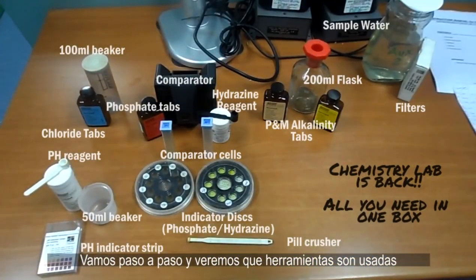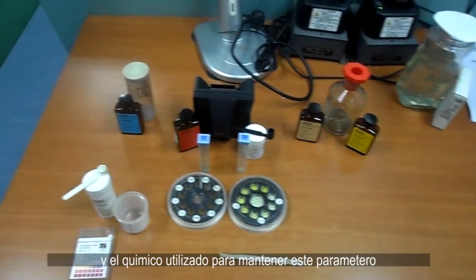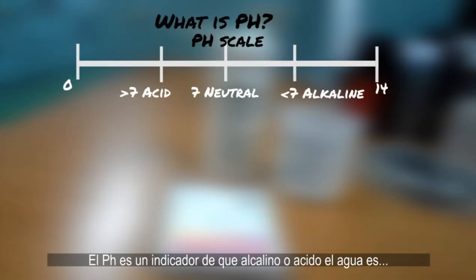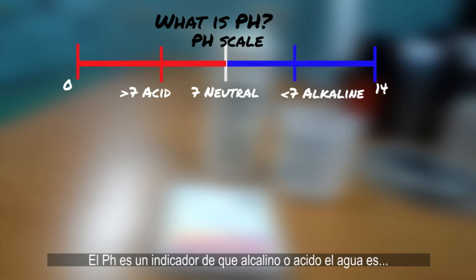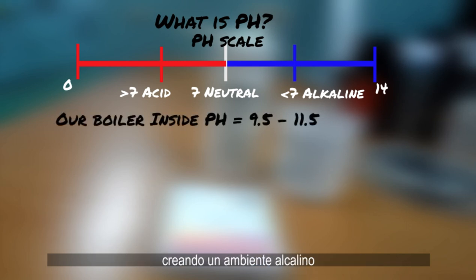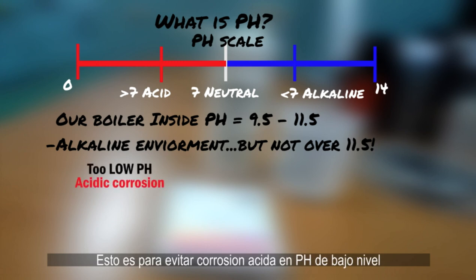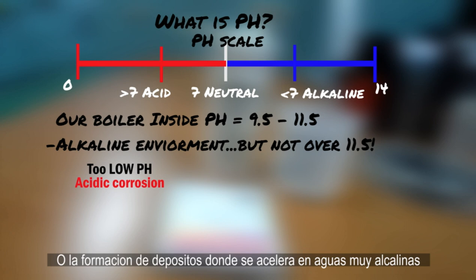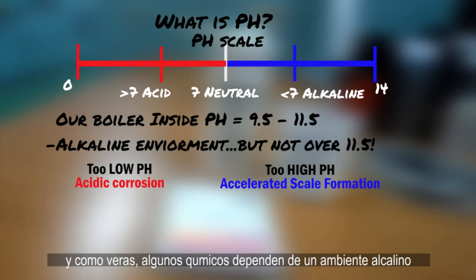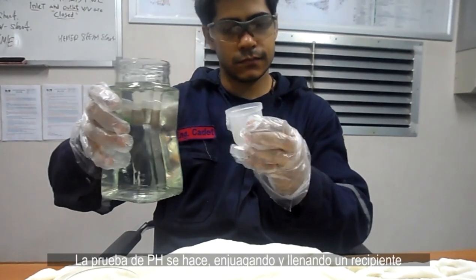Here's what's included in the Unitor boiler water test kit. We'll go through everything step by step — the tools used, why each parameter is important, and the chemical used to maintain it. Let's start with the most simple test: pH. pH is an indicator of how alkaline or acidic the boiler water is. It should be maintained between 9.5 and 11.5, creating an alkaline environment without going over the limit. This avoids acidic corrosion from low pH and scale formation which is faster in very alkaline waters.